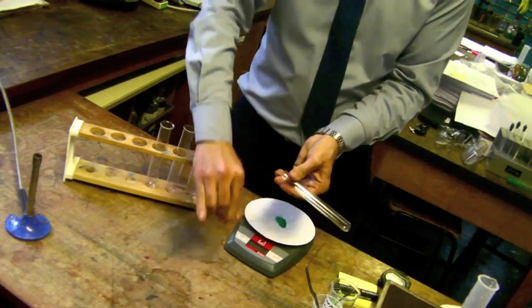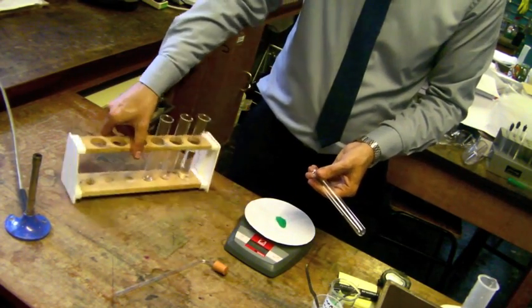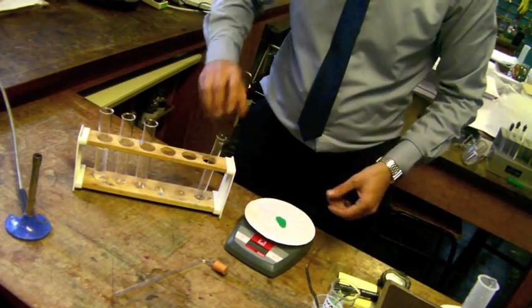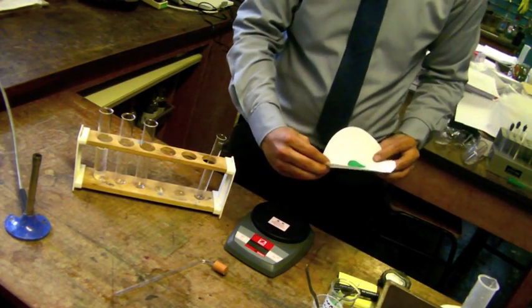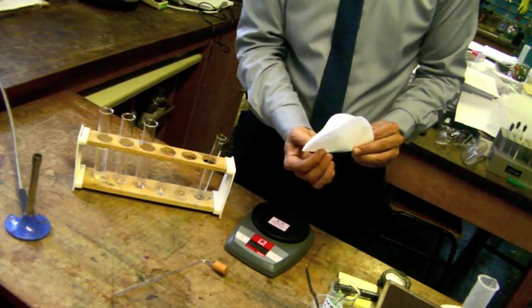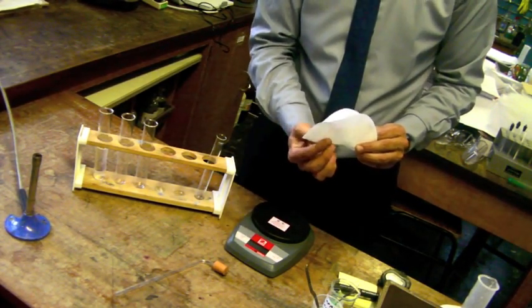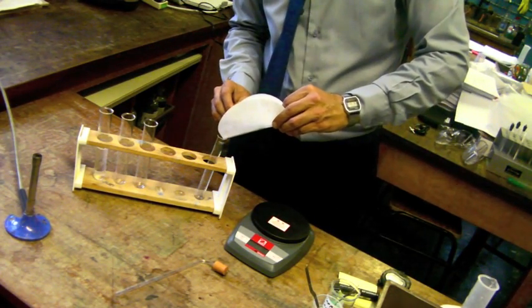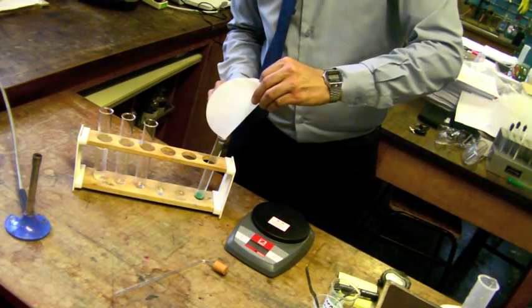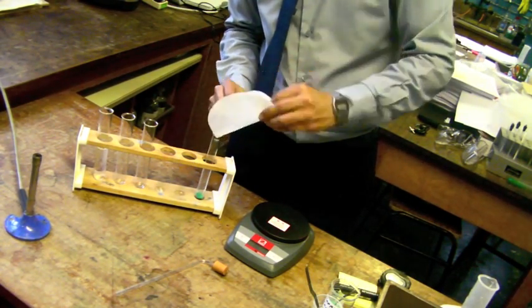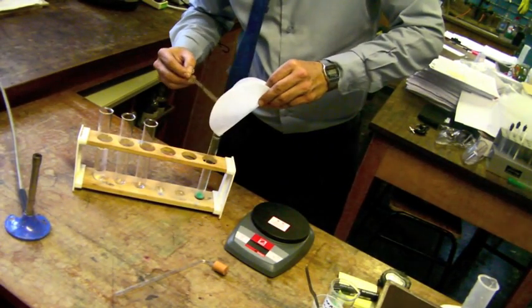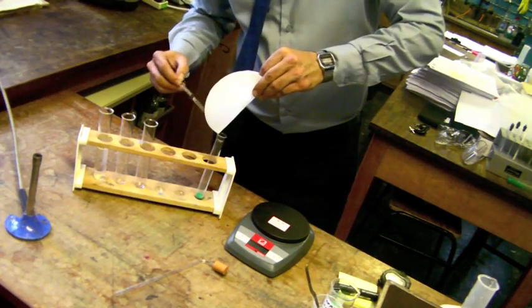Now we should carefully pour the copper carbonate from the filter paper into the test tube. Use your fingers to crease the filter paper into a funnel, and then gently pour into the test tube. Be very careful not to spill any. Every last bit must be removed from the filter paper into the test tube.